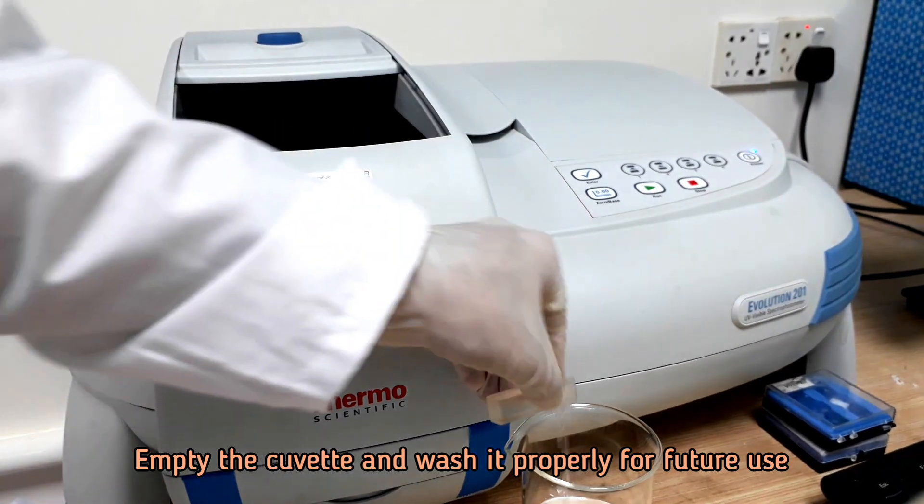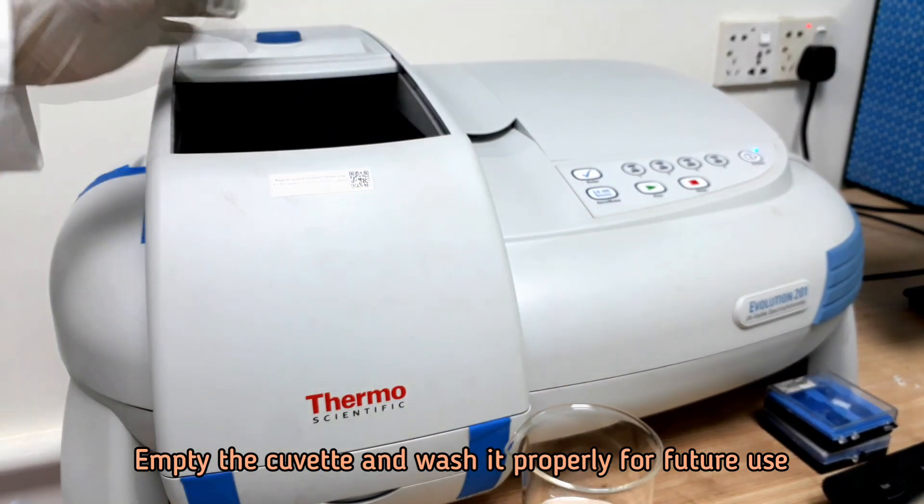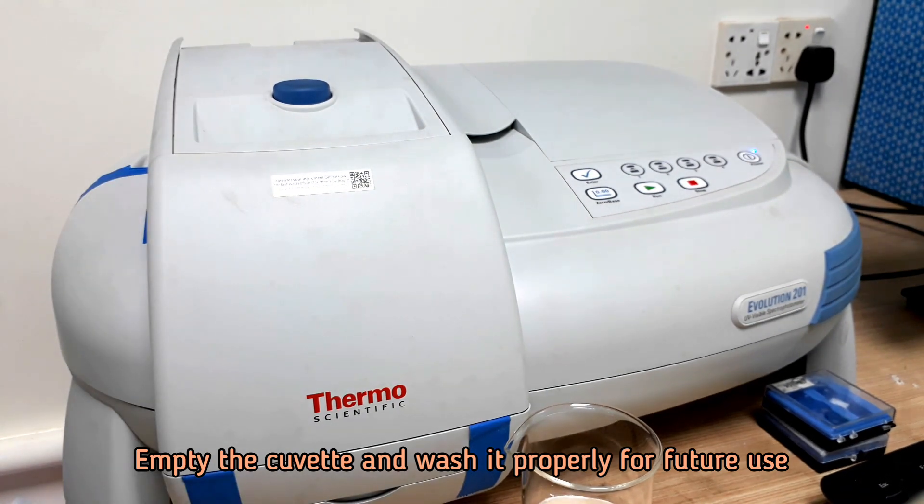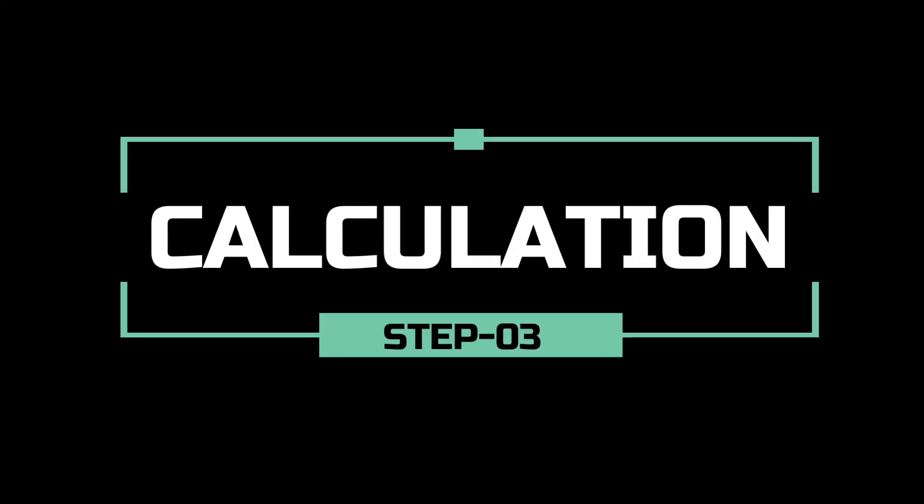Empty the cuvette and wash properly. Let's calculate the gamma oryzanol percentage.